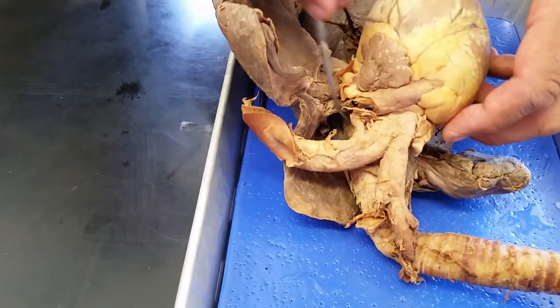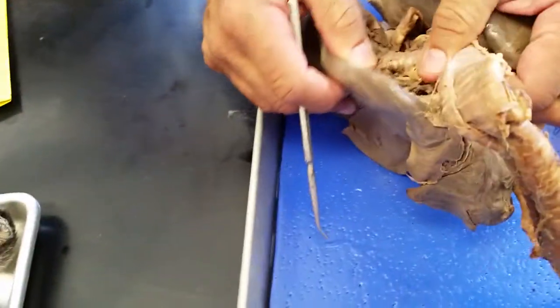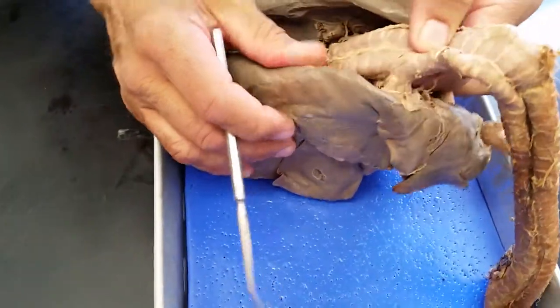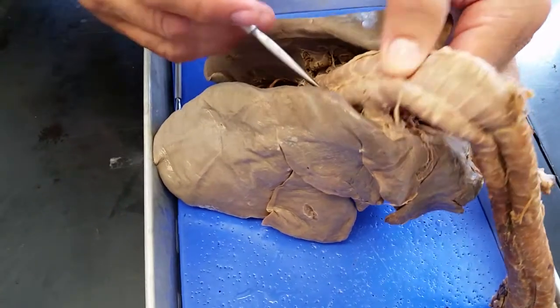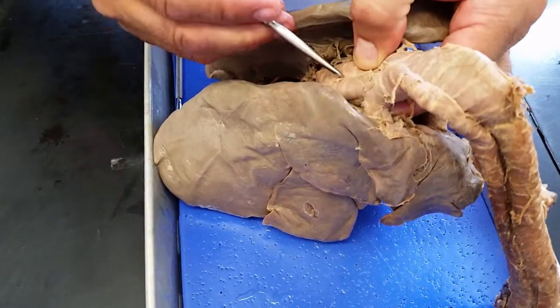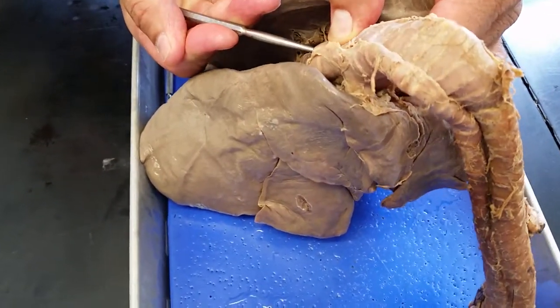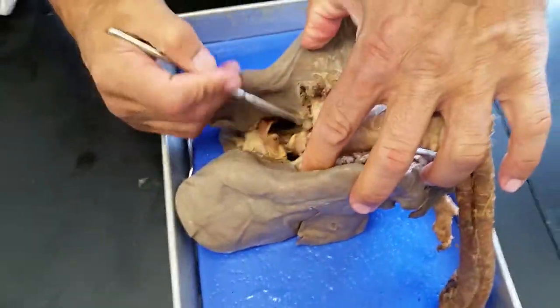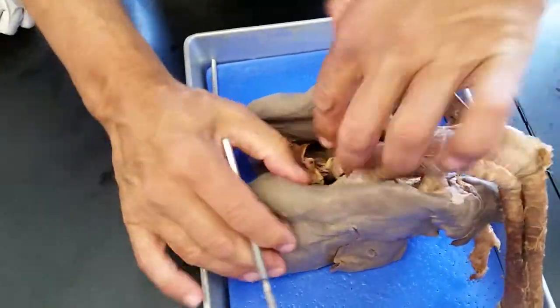And then that would loop around the other way, so if you come off the back of it, you'll see them again. Right here you can see the bronchi really nice back here. You can see the posterior trachealis muscle within here. I went right through it with no problem. Then you can see the primary bronchi on each side with no trouble.